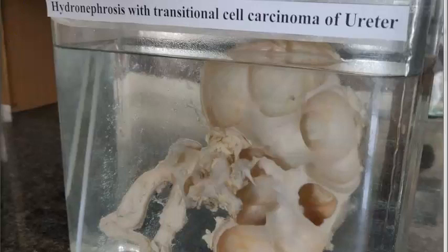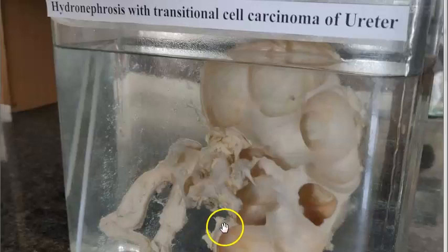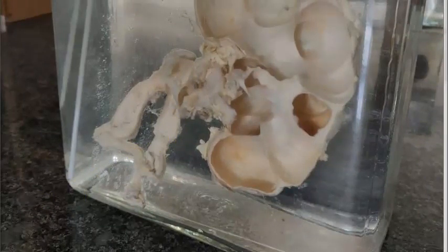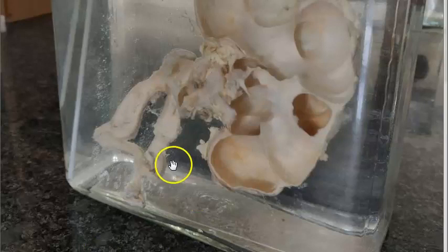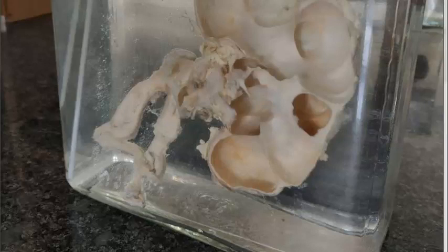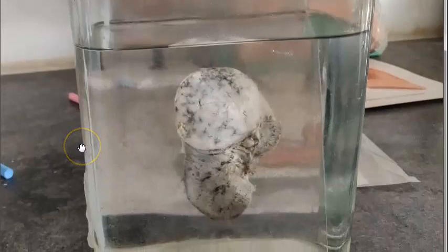Hydronephrosis of the kidney — you can see dilated spaces here, calyces, pelvis, and a thin cortex. Here there is also transitional cell carcinoma of the ureter — a papillary type, free-floating fern-like arrangement, friable mass in the ureter. Grading in microscopy goes Grade 1, Grade 2, Grade 3.